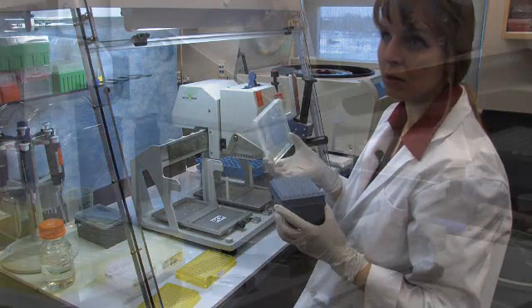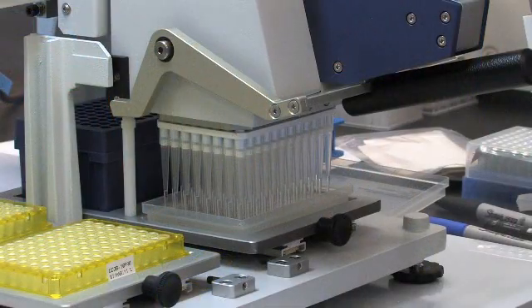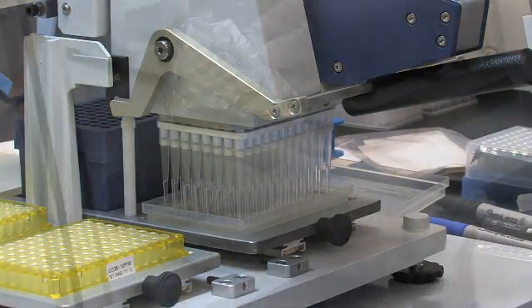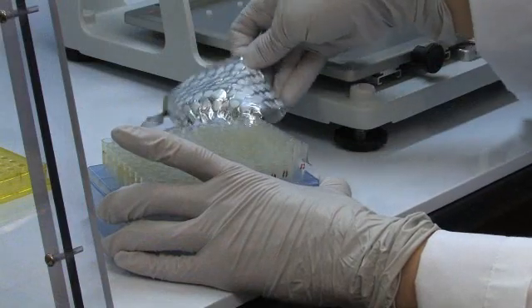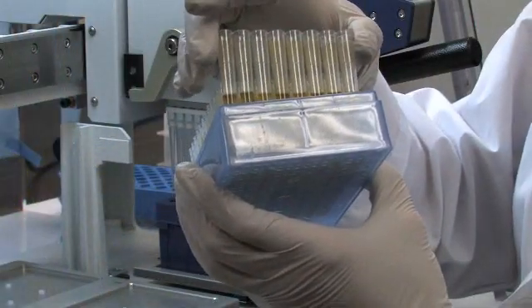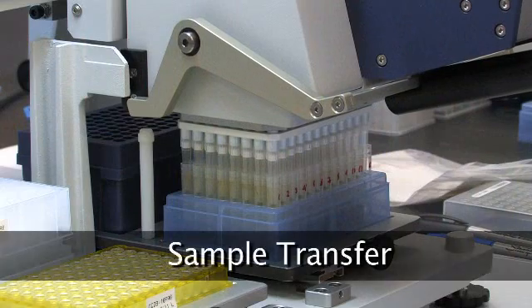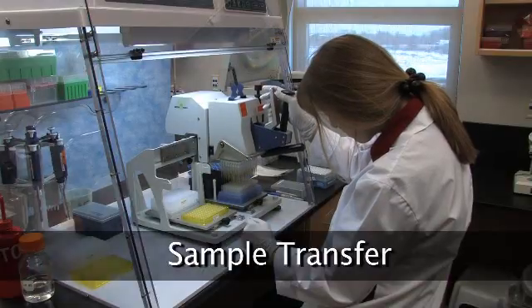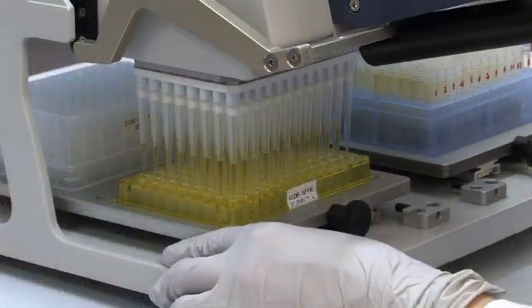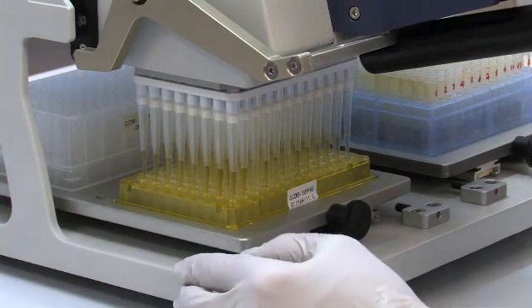The lid of the liquidator 96 tip box is sterile and can be used as a reservoir. From a plate containing tube racks with plant extract in lysis buffer, 50 microliters of lysate is transferred from the 96-well tube rack to a plate that contains 100 microliters of binding buffer.